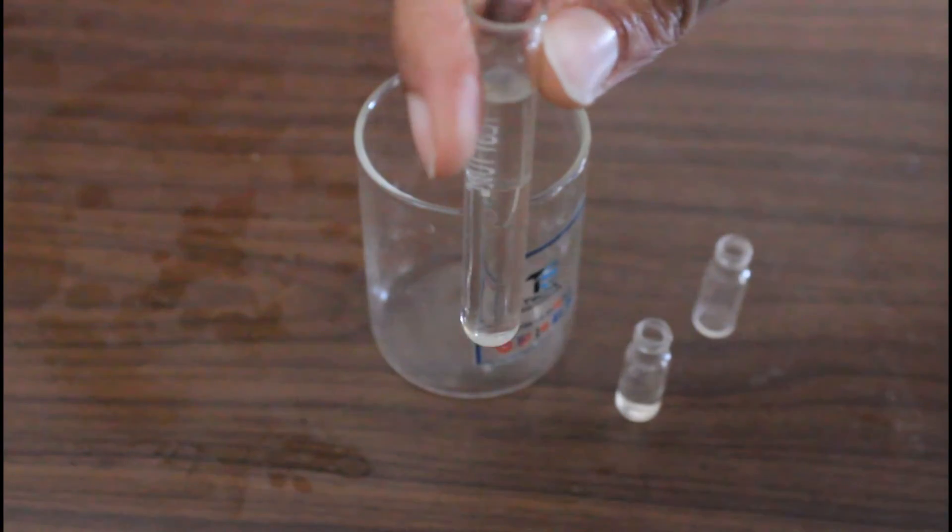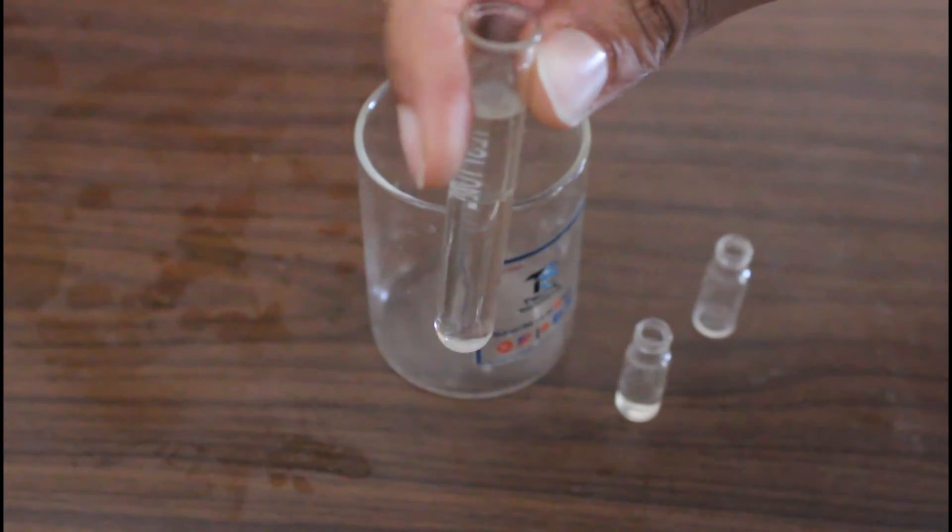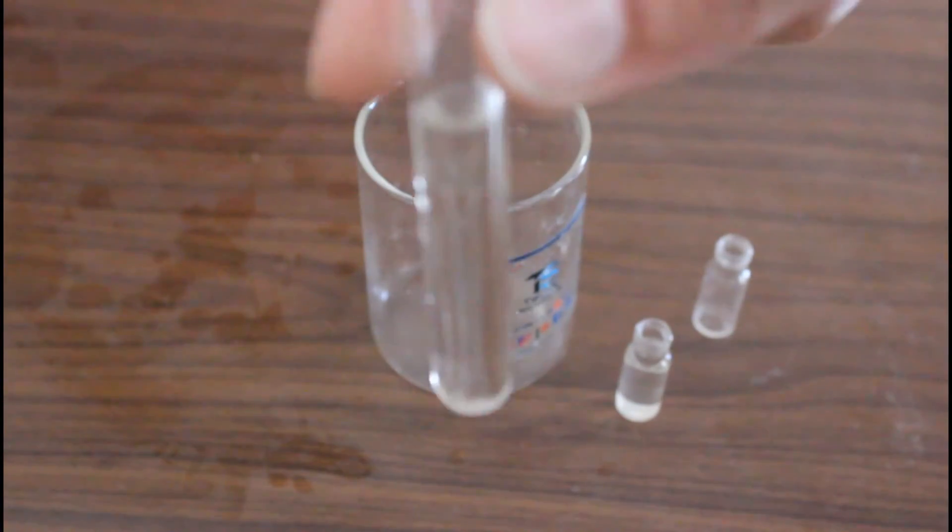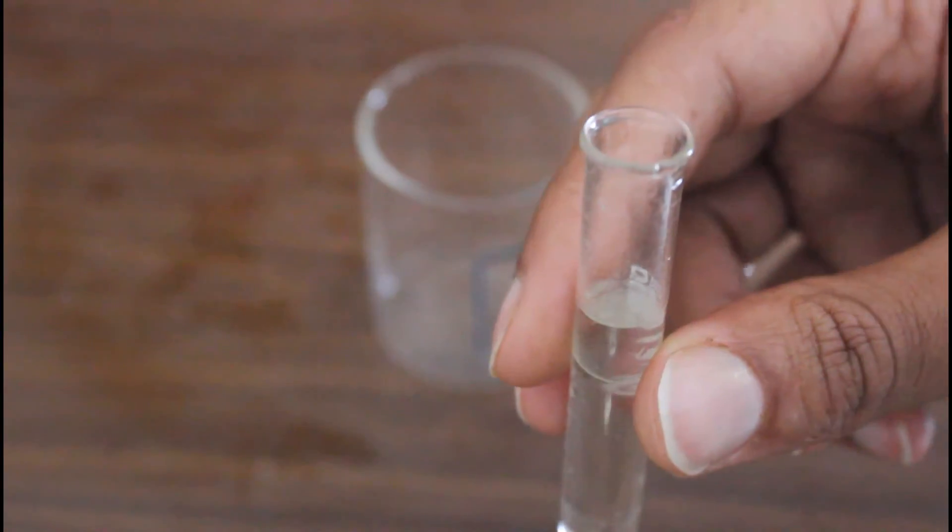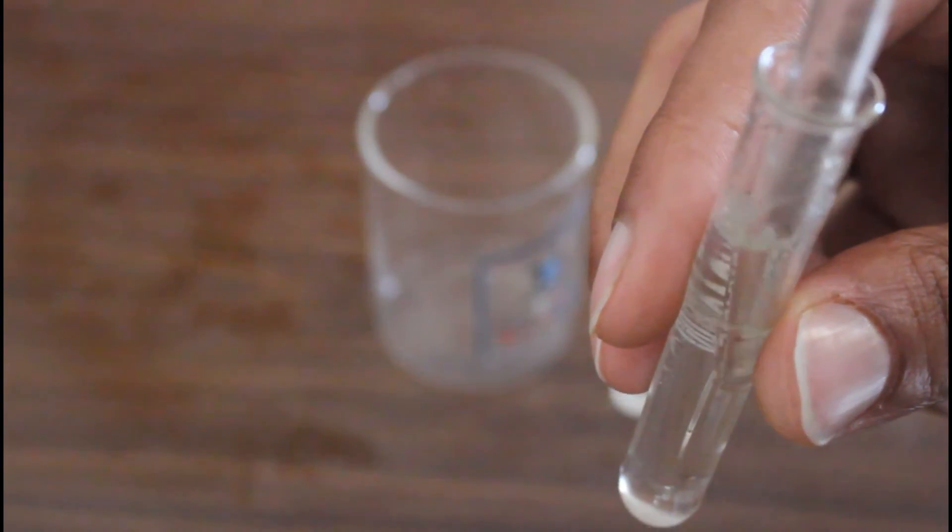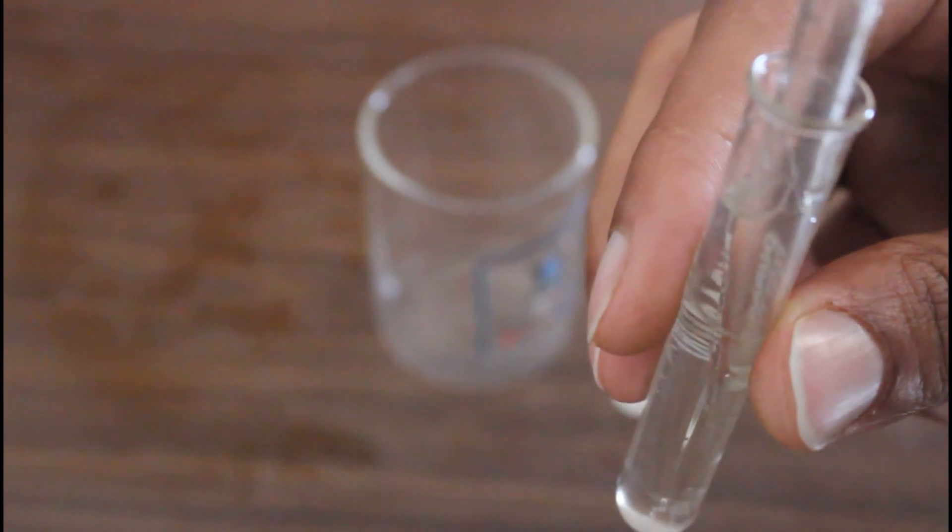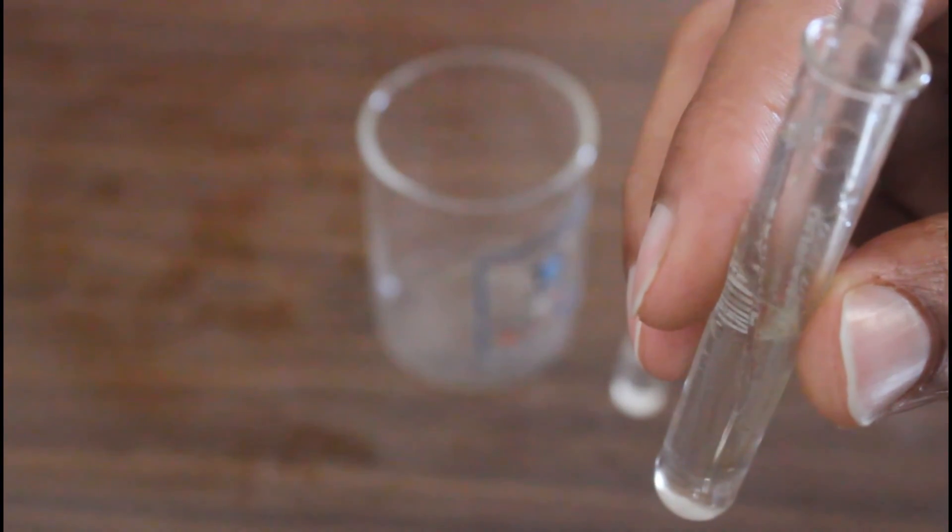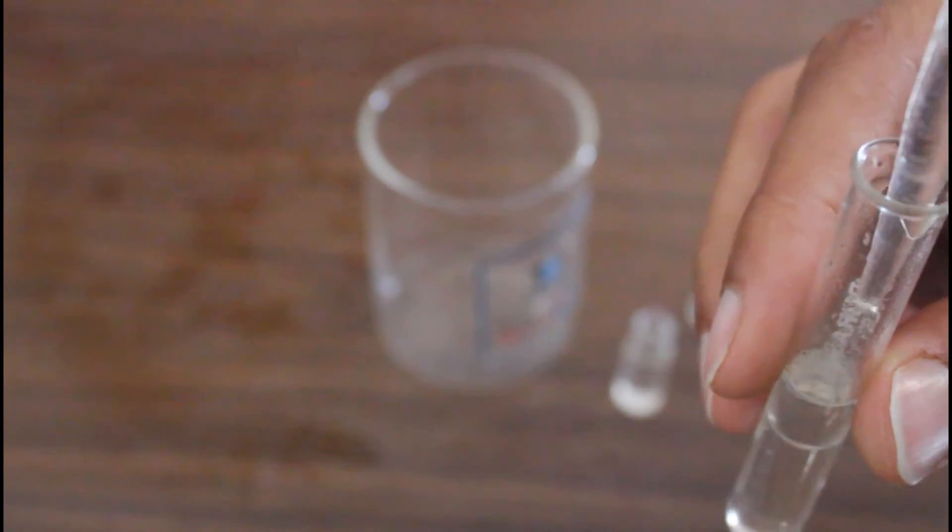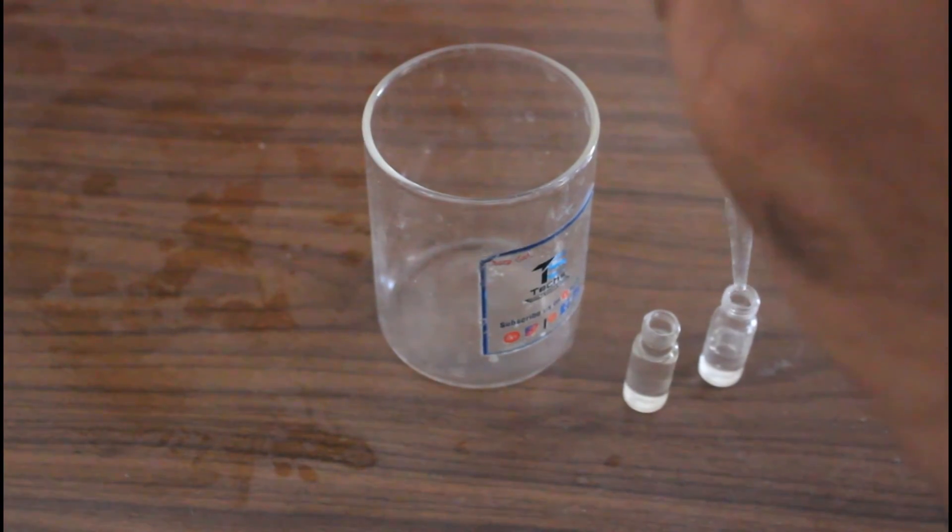First of all I will take the upper layer. Okay, now I will collect the lower layer. I will put it into another container.